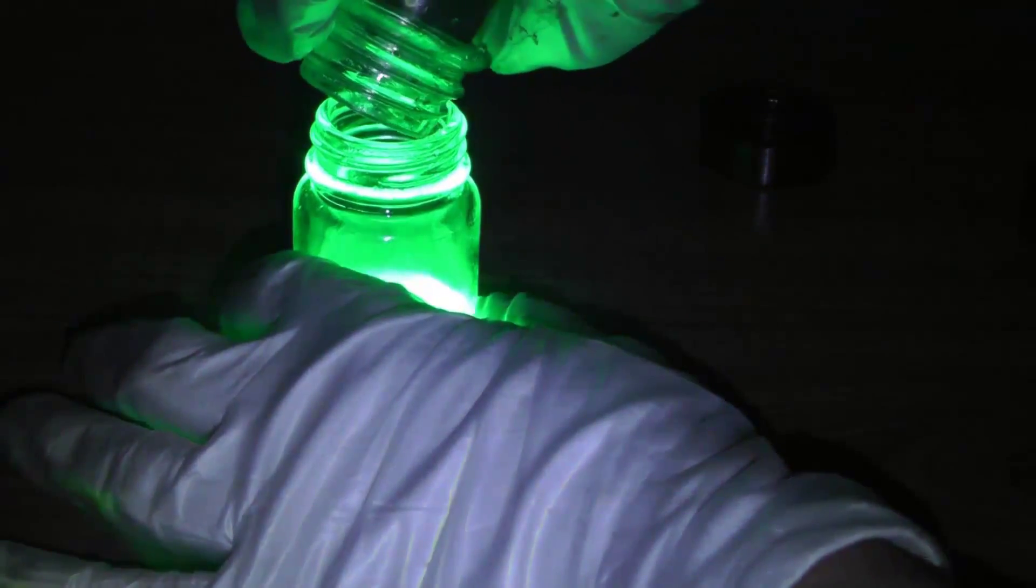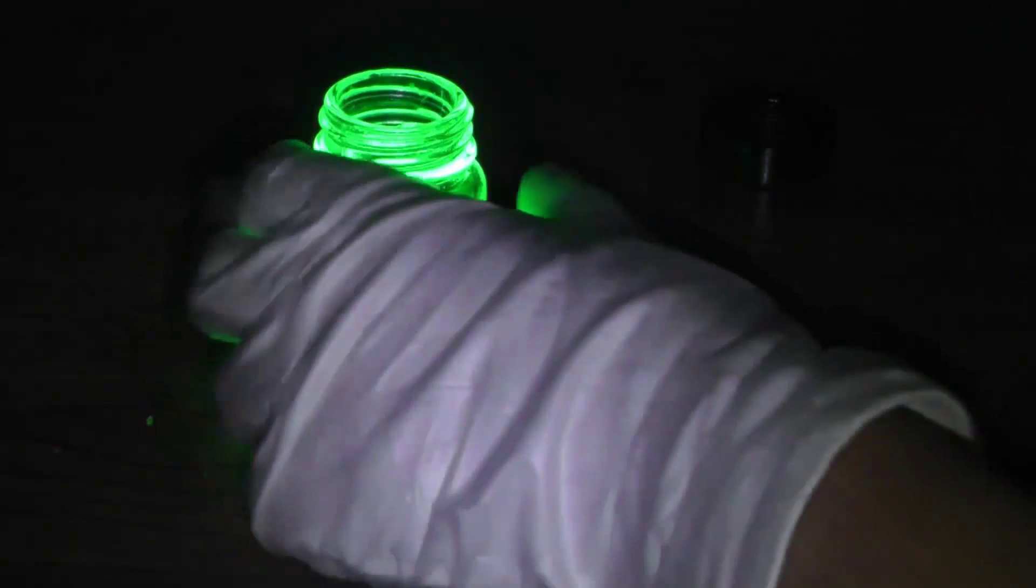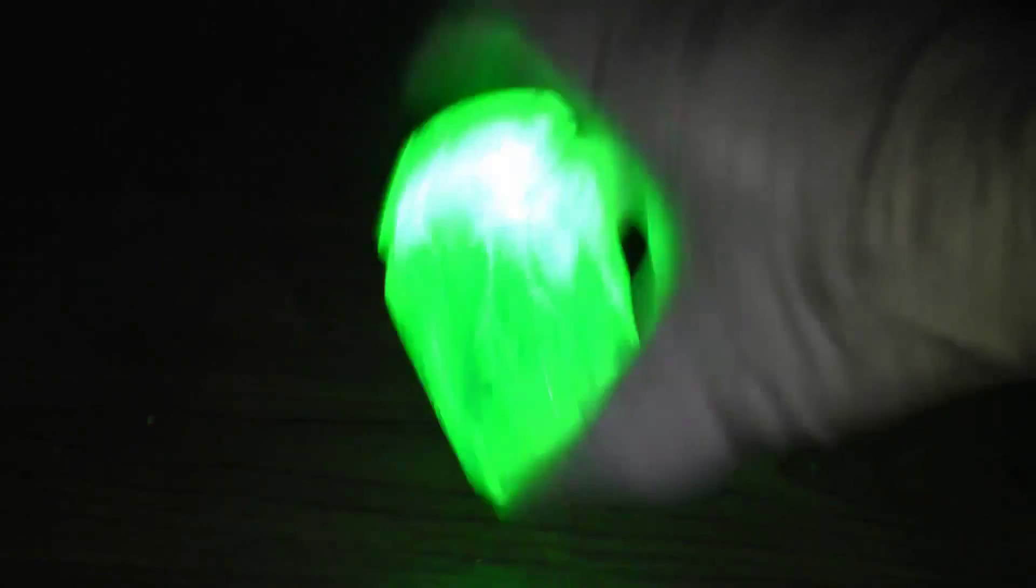And now you get a really bright glow stick reaction. The dye I used gives a cool plutonium effect if you were using it in a sci-fi movie or something, or even an ectoplasmic goo.